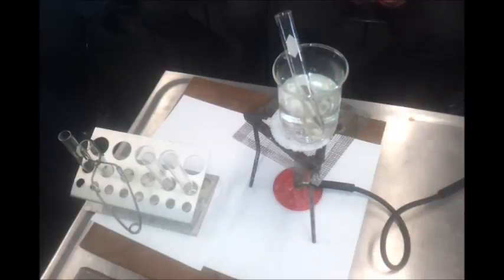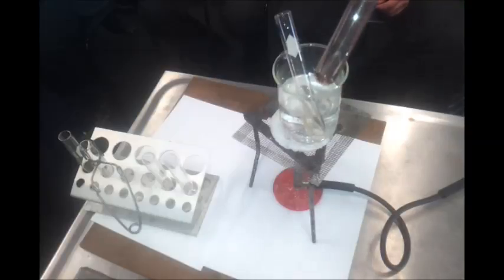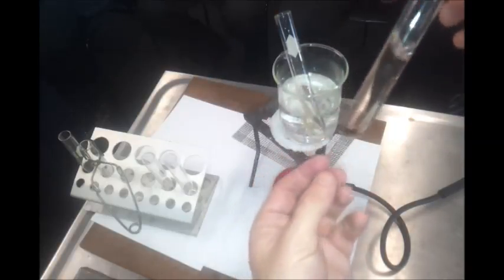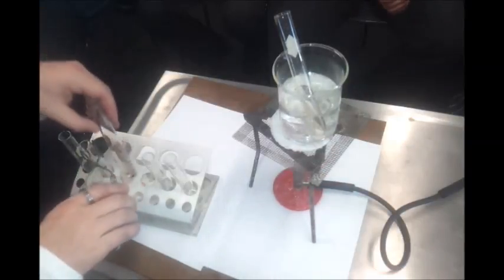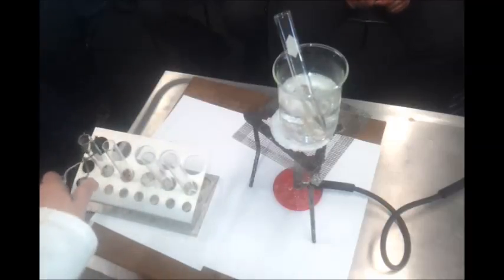For those that can't see, I'm just pouring it because I've gone way too far with manganate. Right, and it does go to a pale pink and then eventually to colourless. All right, so it loses its colour. Getting a slight brown in there too because I haven't got quite enough acid in there. All right, going to do the next one a little bit more sensibly, where I add the dichromate to my ethanol and see what happens.